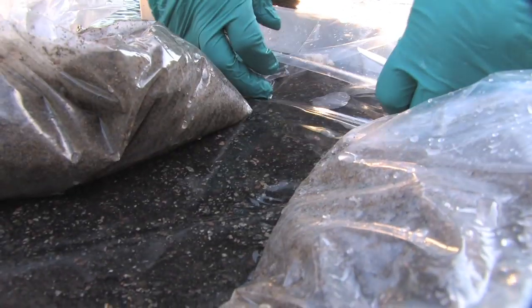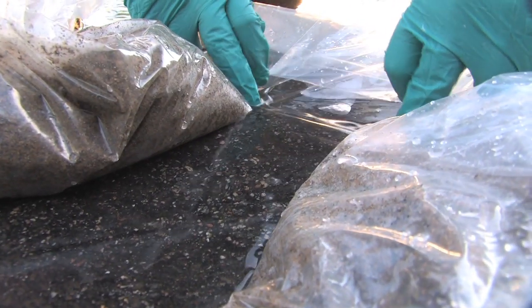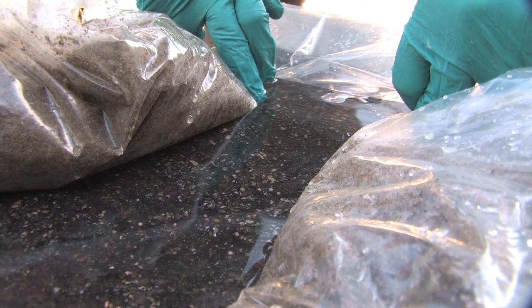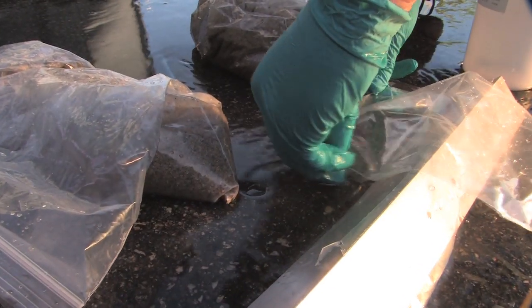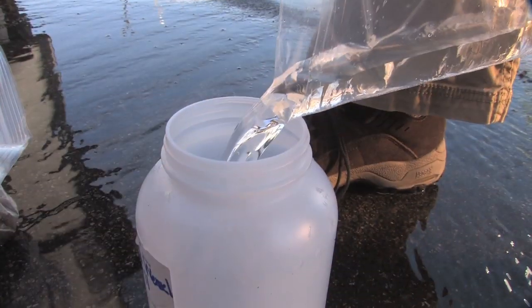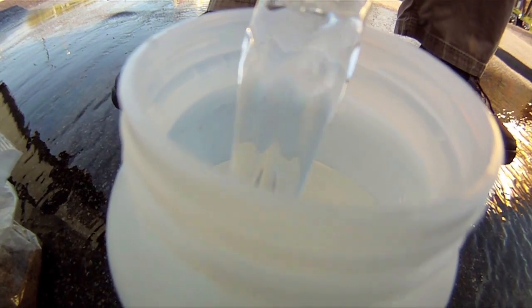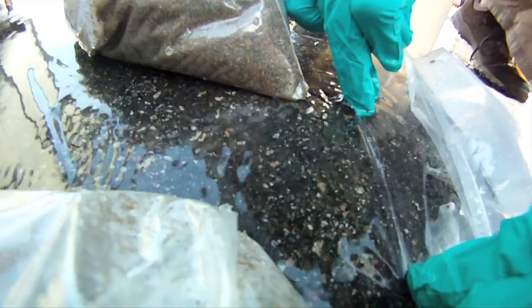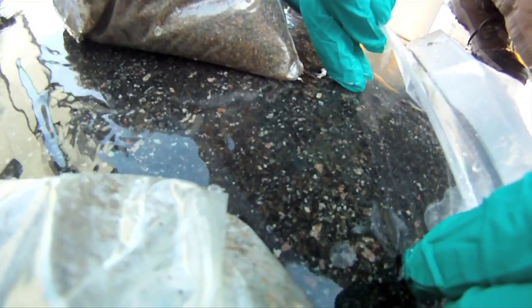Place your fingers inside the bag to open the bag's mouth. Place it over the shovel handle or other device to allow the stormwater to flow inside the plastic bag. Lift the top of the bag to transfer the sample to the bottom of the bag. Continue until you have enough stormwater in the plastic bag. Shake the plastic bag and pour the sample into your sample jar.